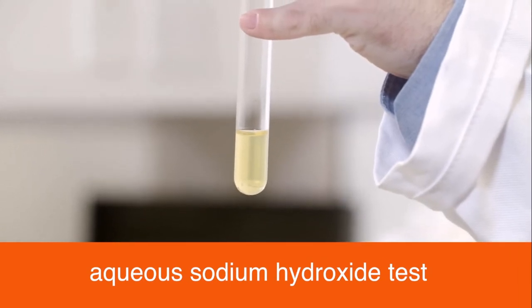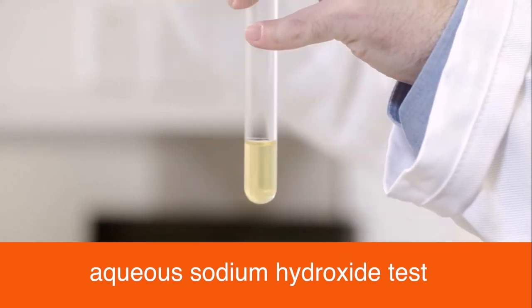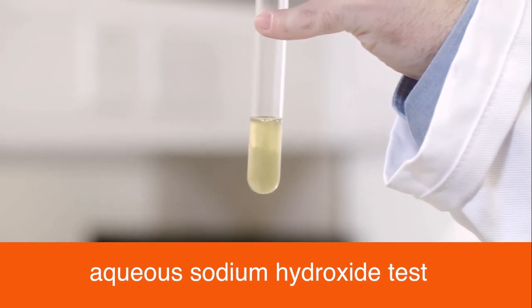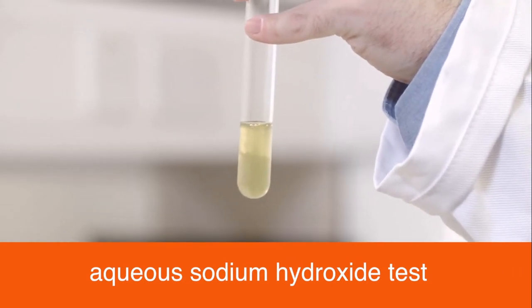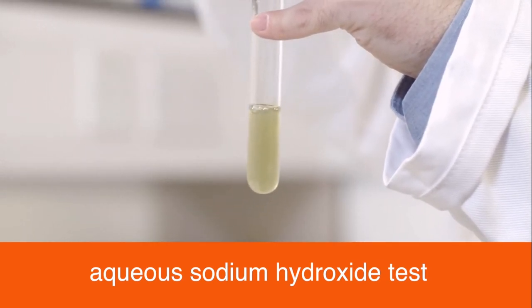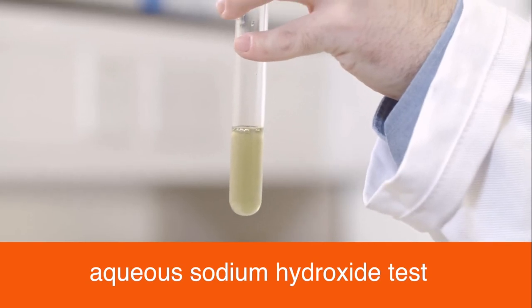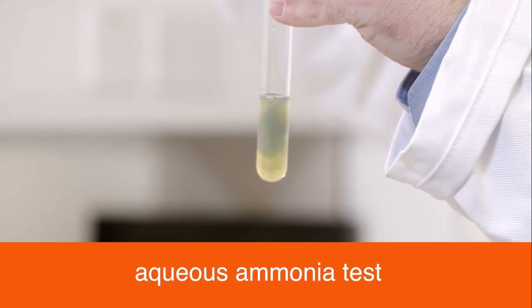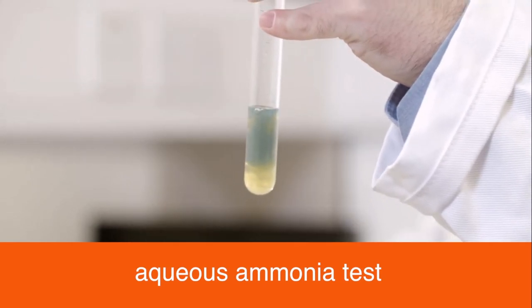A green precipitate, which is insoluble in excess when aqueous sodium hydroxide is added, indicates the presence of iron 2. The same result is observed with aqueous ammonia.